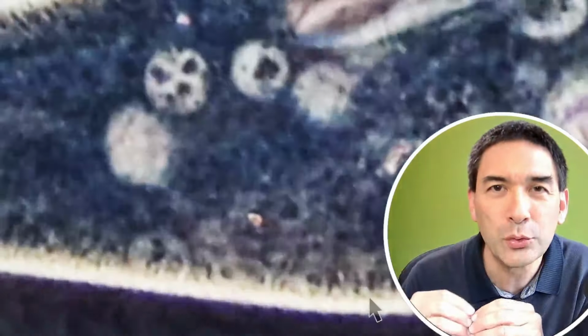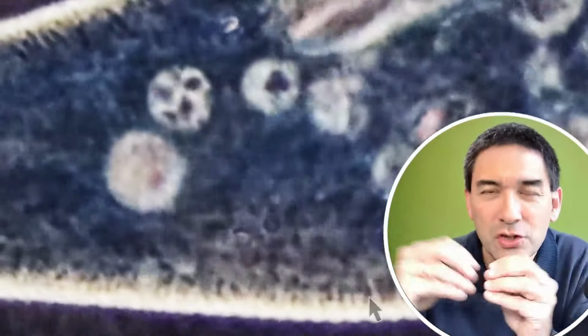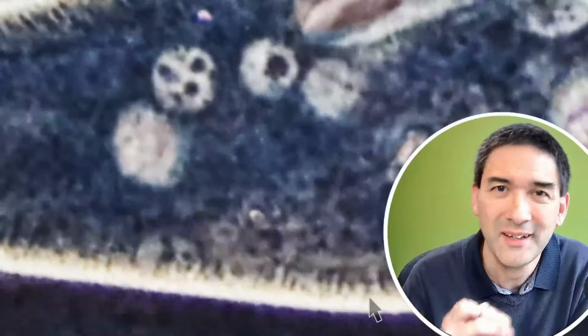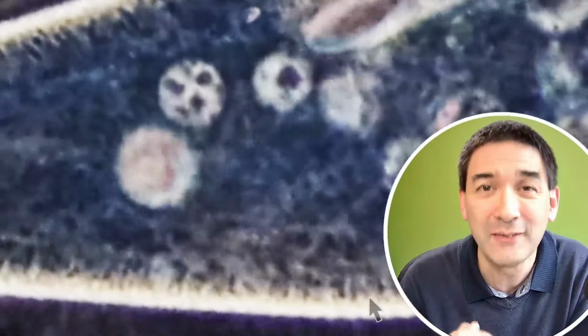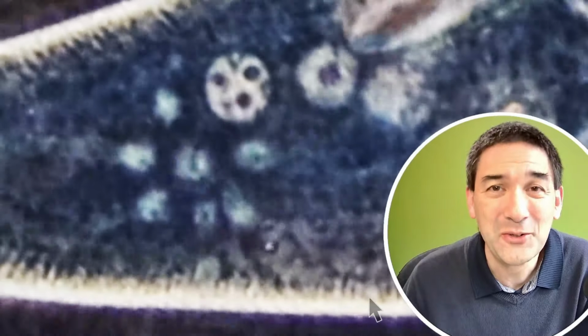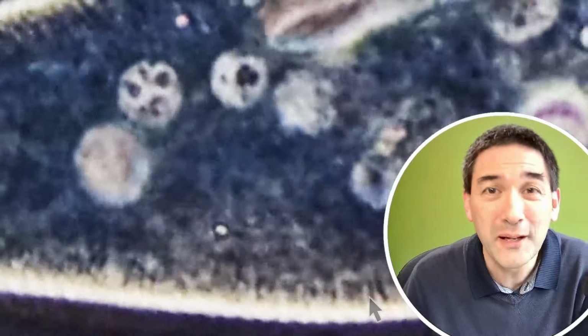Now, how is it able to do that? Well, there are so-called microtubules. These are protein fibers surrounding the contractile vacuole, and those microtubules pull together and compress the contractile vacuole, and this causes the water to be expelled out of the cell again. Now, I think it's always quite fascinating to see all of these processes of life so well under the microscope.